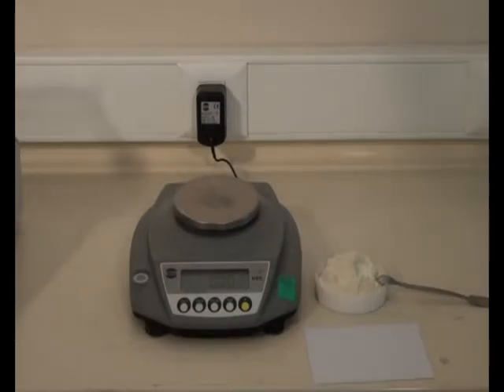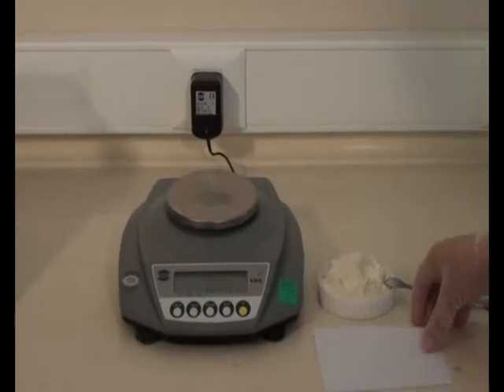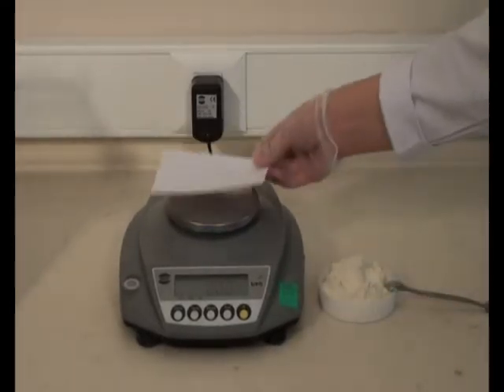For the modified sedimentation test, the weighing box is to be tared and a 3.20g sample is to be weighed.